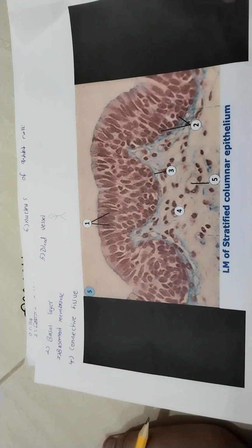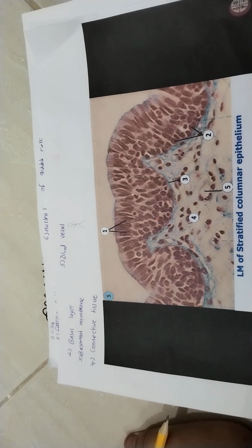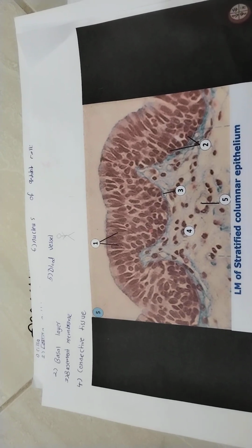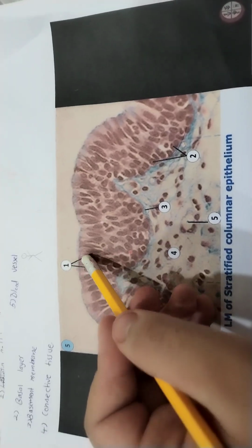So, in another practical exam, you will go to a lab and you will do it. That's different. Your first year of college. We will solve those number by number, and I wrote the numbers here. So number 1 is a nucleus.